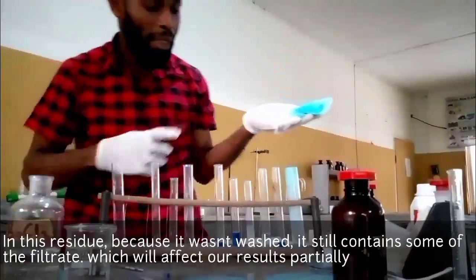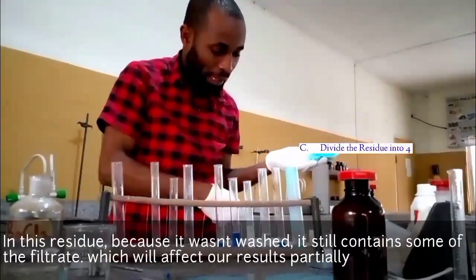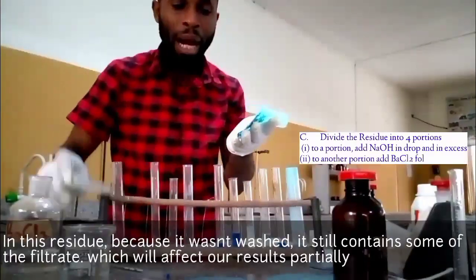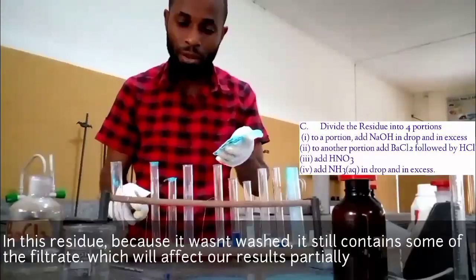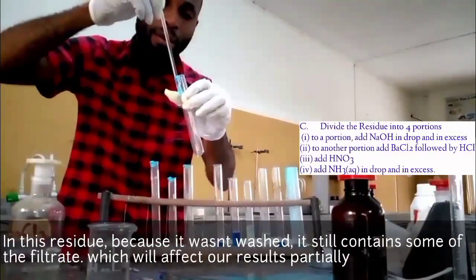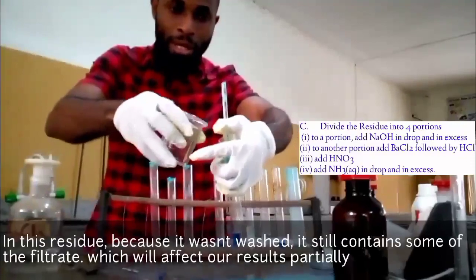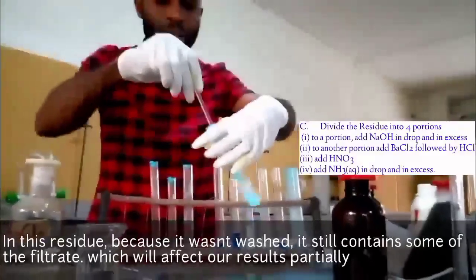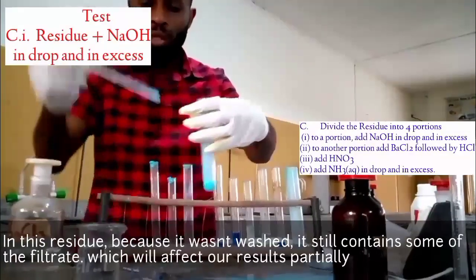Okay, what I'm going to do is divide it into 4 portions. According to what I have here, it says divide it into 4 portions and carry out the other exercises. The first exercise is, to the first portion, add sodium hydroxide in drops and then in excess. Let's get this. I will divide this into 4. Before that, let me pull this in, then add a little drop of water inside it. Remember, I said that it's not going to be soluble, but you can have some color you can work with.